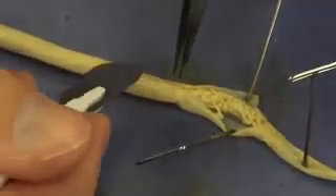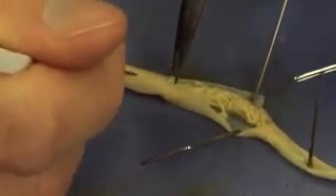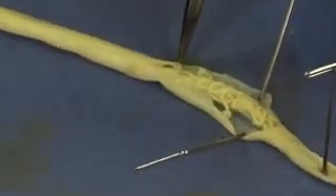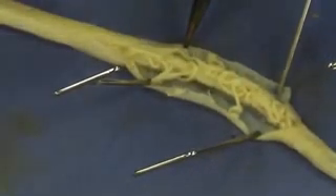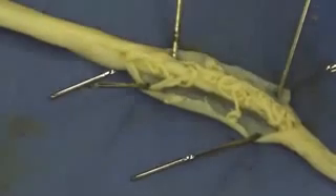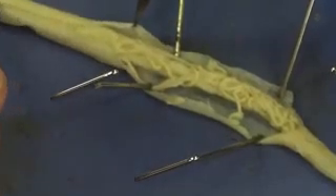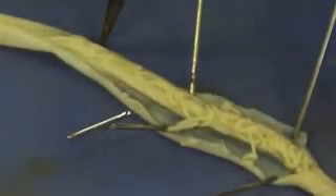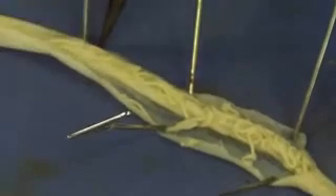That's about one inch. I'm going to continue with my incision very gently, and again begin to reflect the skin backwards. I'm going to grab the skin just a little bit there and continue cutting, and very gently reflect the skin back with the forceps.